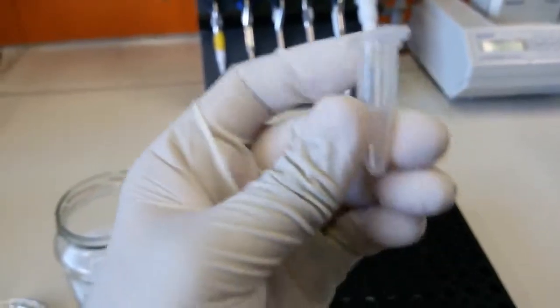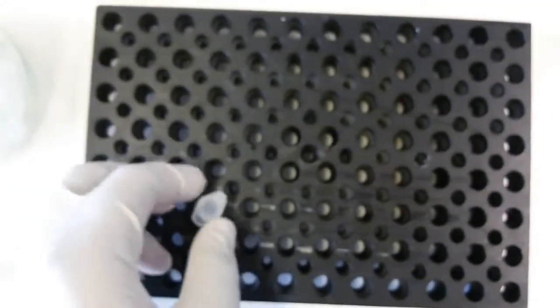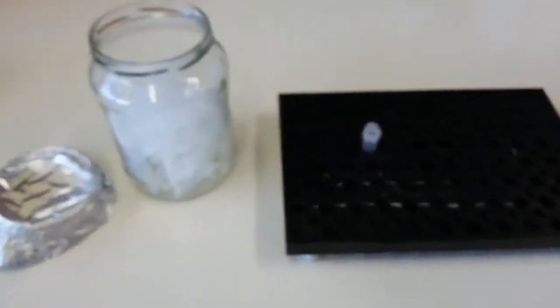And this is the stand which we use. For example, put it like this so you can see it from the top. That's how you do it. You put them, just ignore those small holes, they're for different Eppendorf tubes. You put them like this, and on the top or on the side you can write the name if you want to specify something.